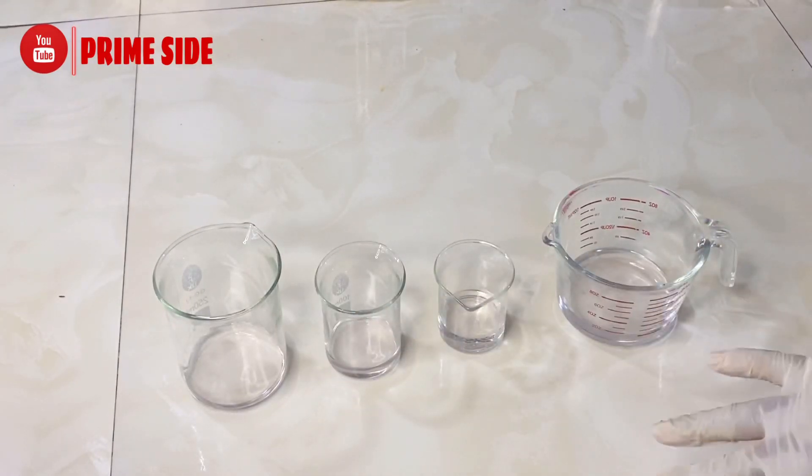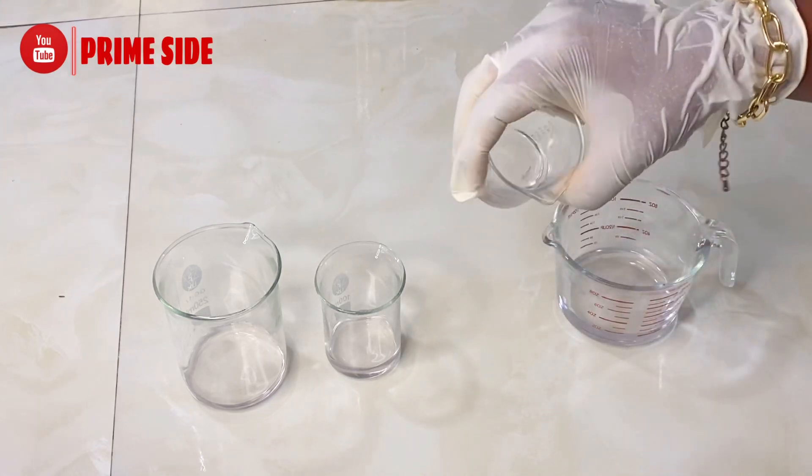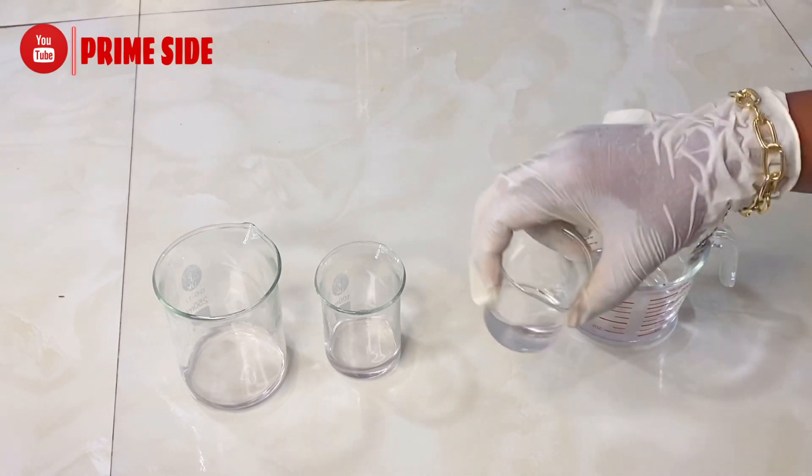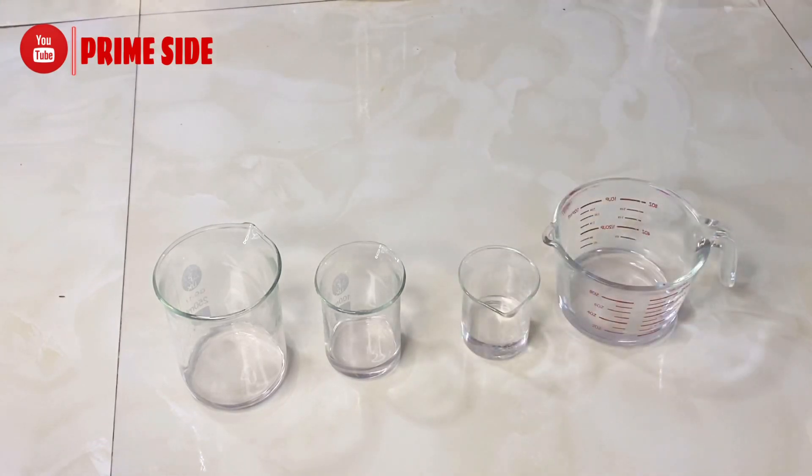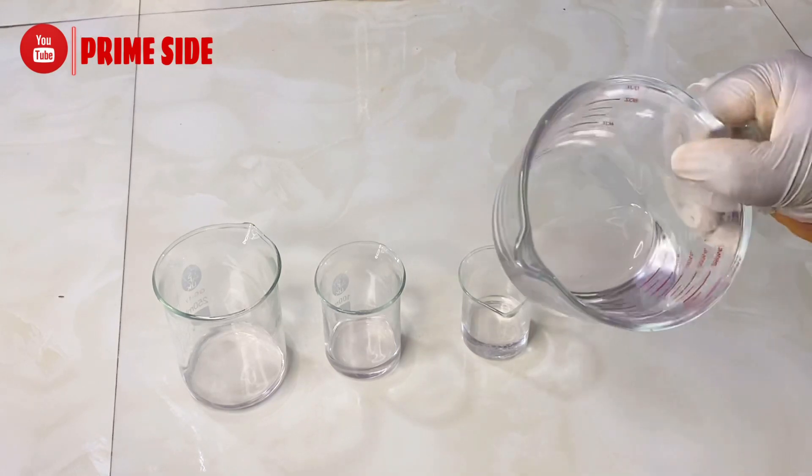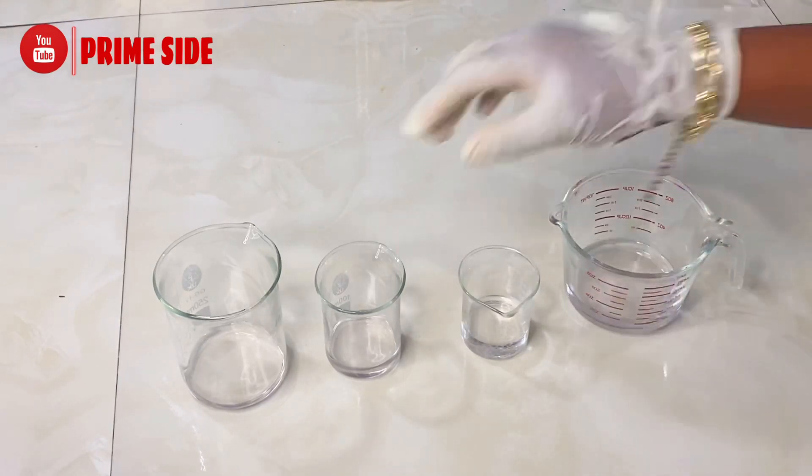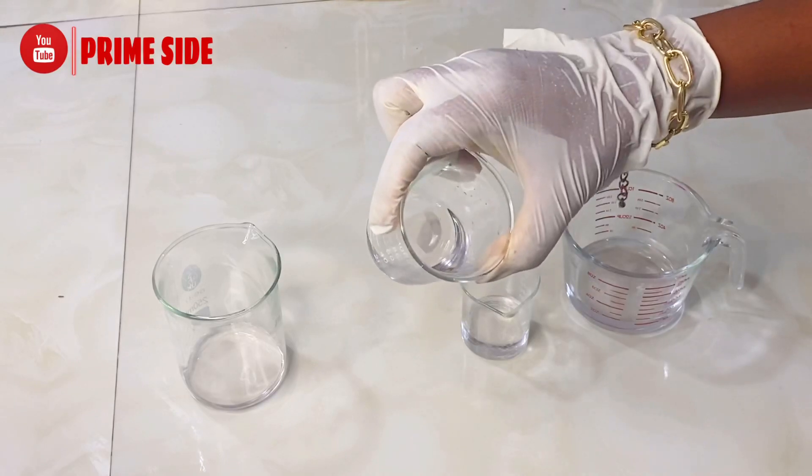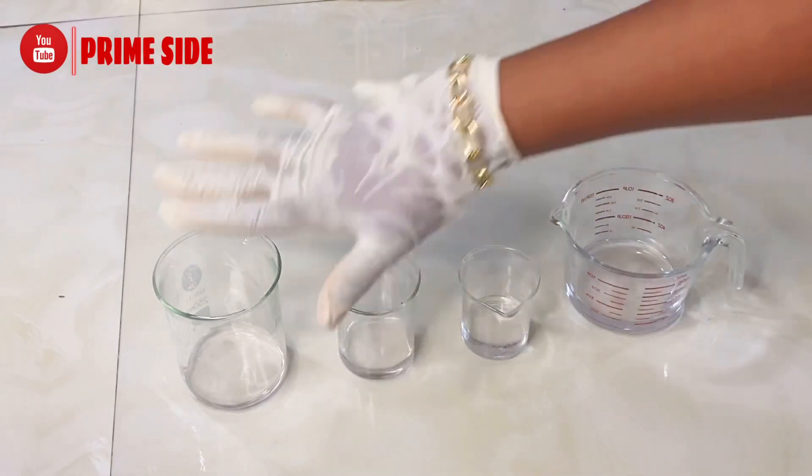So these are a range of them, and from this experiment it is clearly deduced that propylene glycol dissolves salicylic acid more and saves more time. But to hasten the time, you have to crush your salicylic acid in your porcelain mortar.